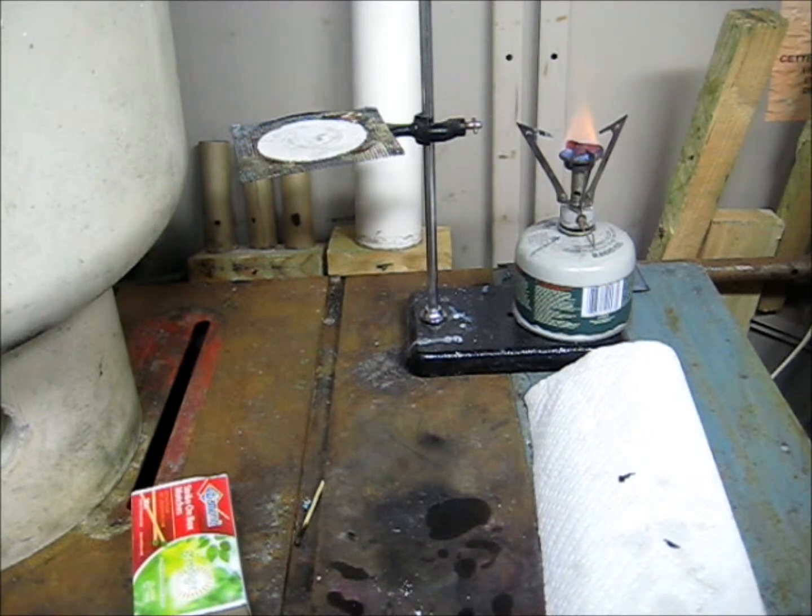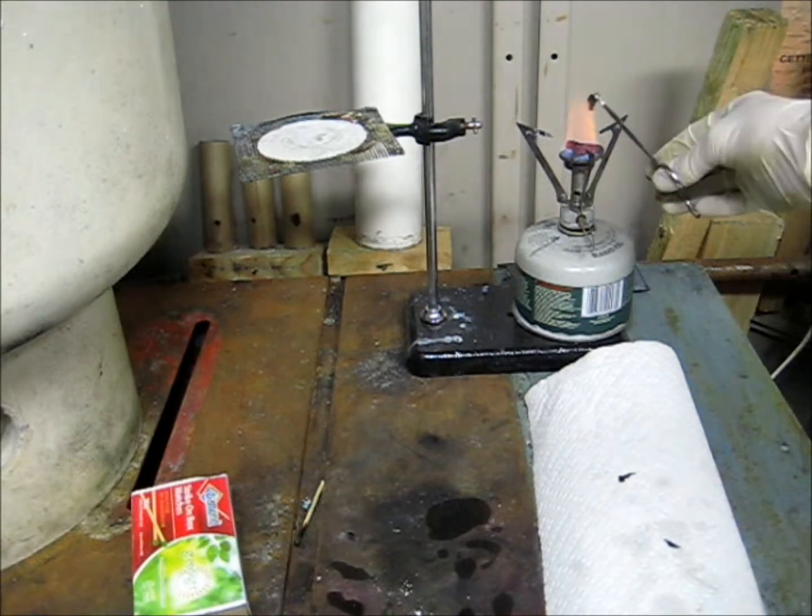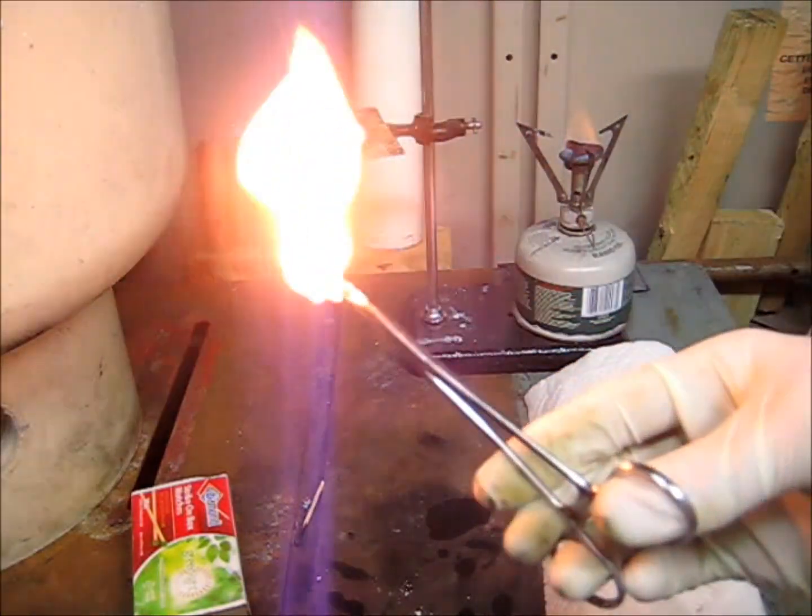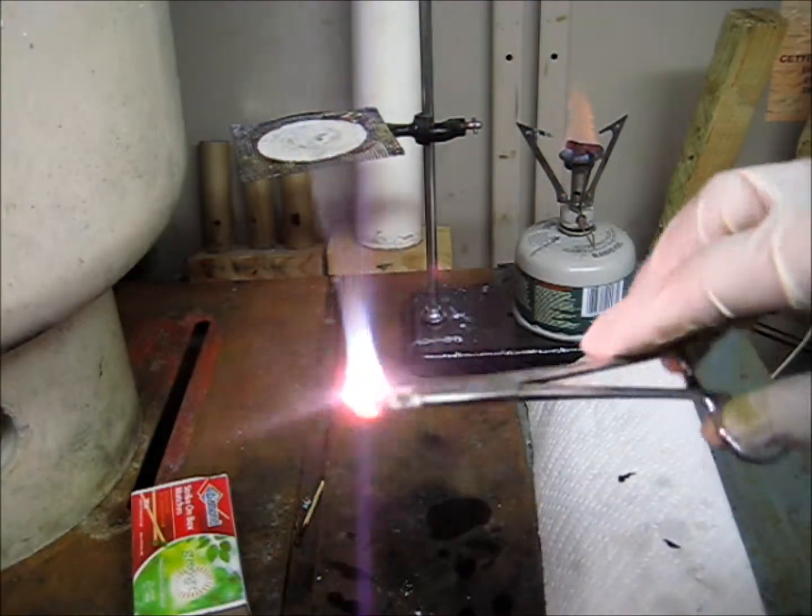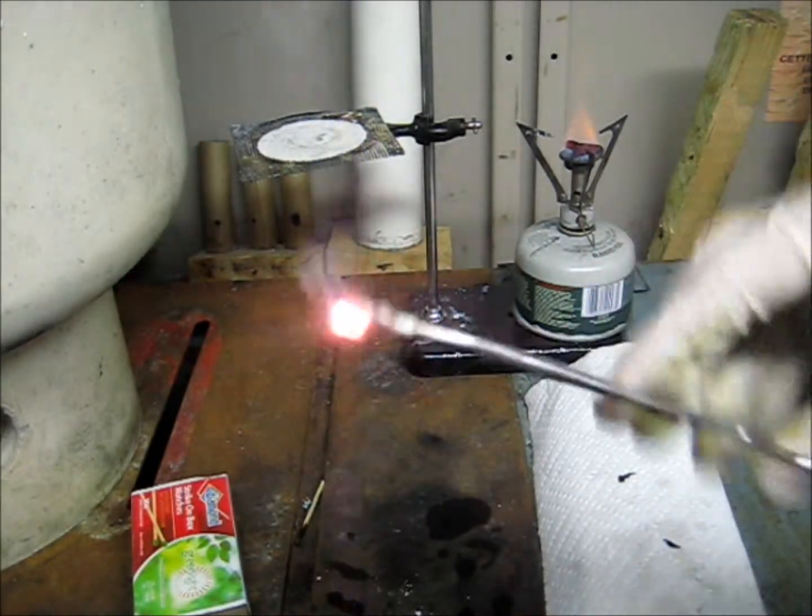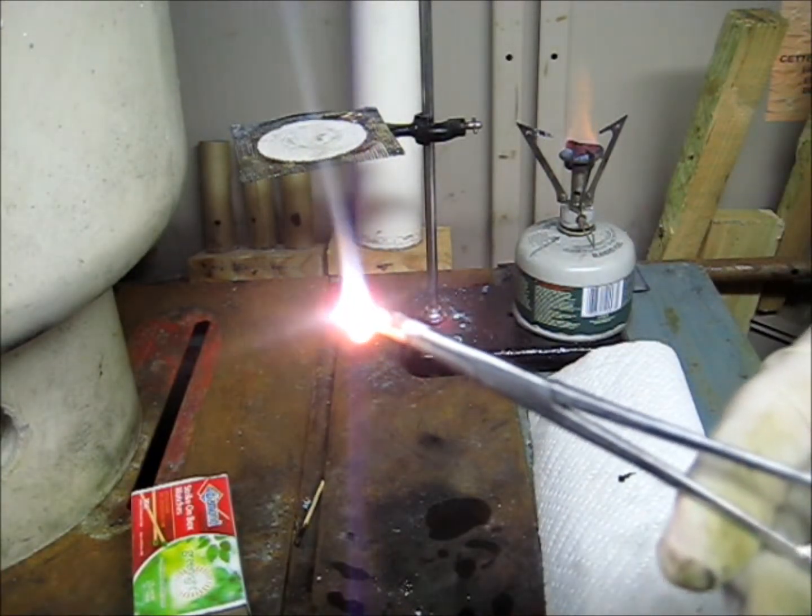Lithium when it burns also is extremely hot. So if you're doing this in a glass beaker, you light it and you throw it into a glass beaker, it's going to be a little bit more vigorous and it could possibly melt through the glass. I've had that happen a couple times.